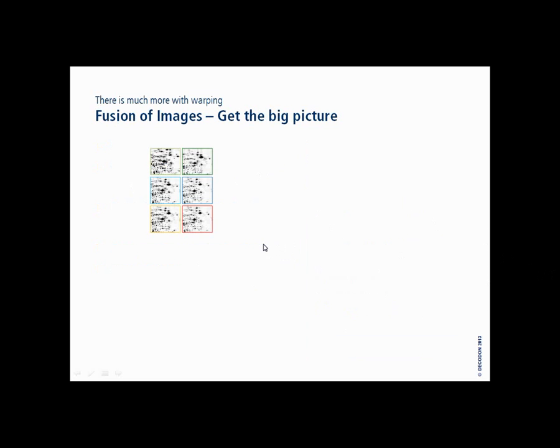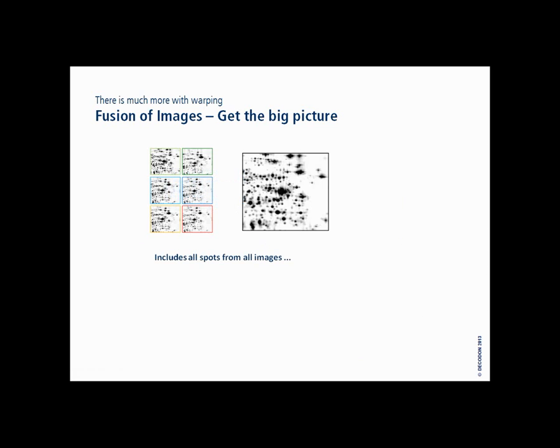Image fusion is something very useful. We have introduced this to create one image which includes all the spots. As you can see now, if you fuse the images, we get a resulting image where all the spots are collected from all the original images, and from whichever image they come, they appear together here, even if the proteins would never appear at the same time in the organism you study. So this could also serve as a proteome map for presentations where you show all your proteins in one view and you don't have to point to spots on different images to really explain the proteins that you have found in your experiment.